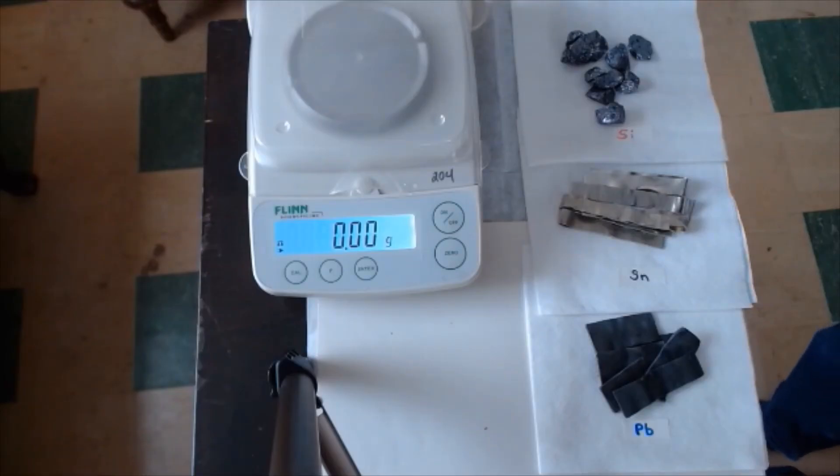All right class, that's it for the data collection, and we'll talk a little bit about the workup here. Okay class, I'm back with the scale and my elements here.